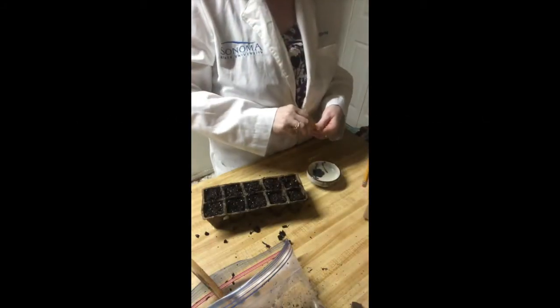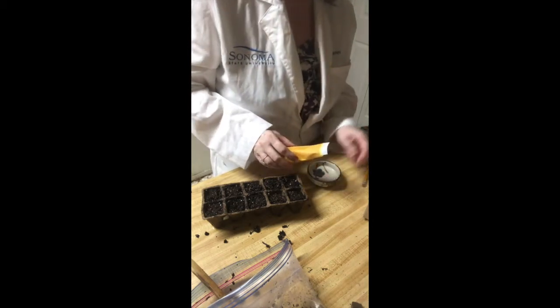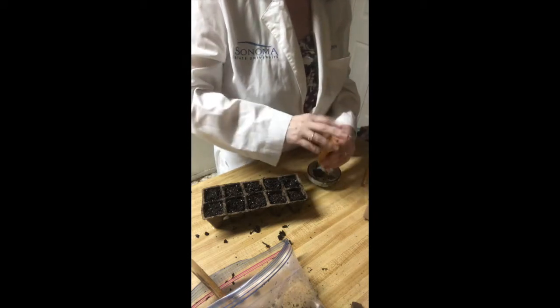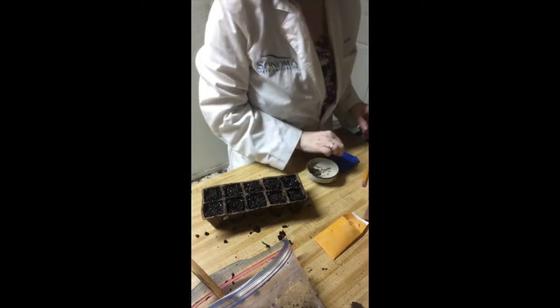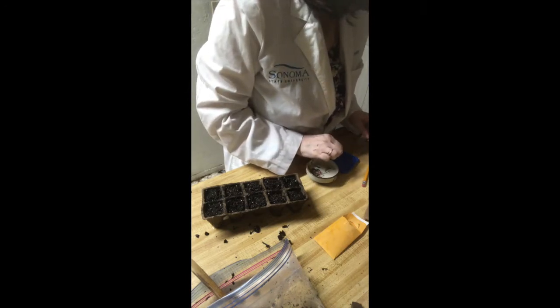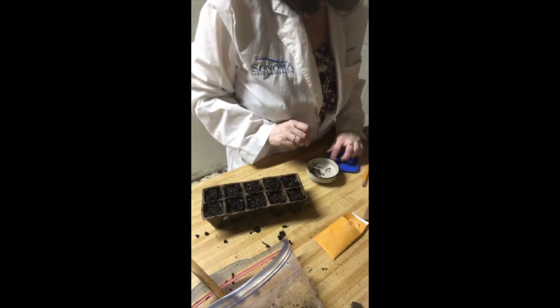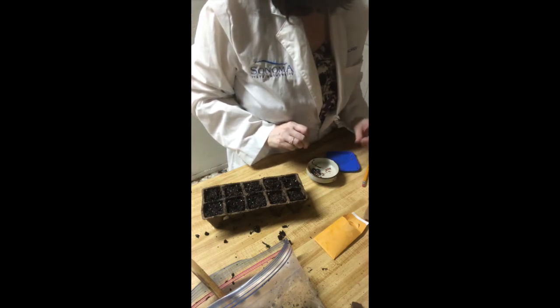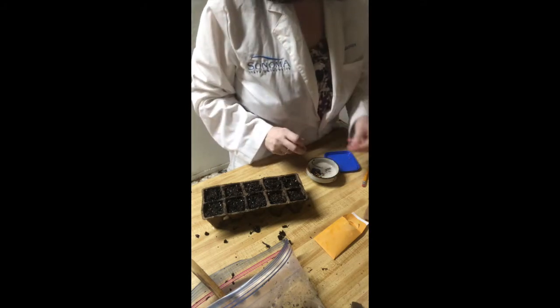Now that we've got our cells filled with the right amount of soil, let's go ahead and get our seeds ready. You'll probably want to put them into some sort of a little ramekin or a little dish — maybe lay a towel or paper towel down on the counter so the seeds don't roll around. In each hole, we're going to plant three seeds. This is a process called over-planting, and your lab instructor will explain why we're doing it this way. You're going to need 15 sets of three seeds. Three seeds will go into five of the pots, and in the other five pots, you're going to be planting six seeds in each.